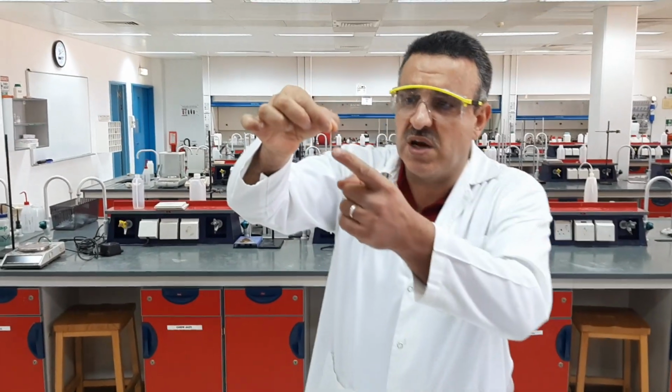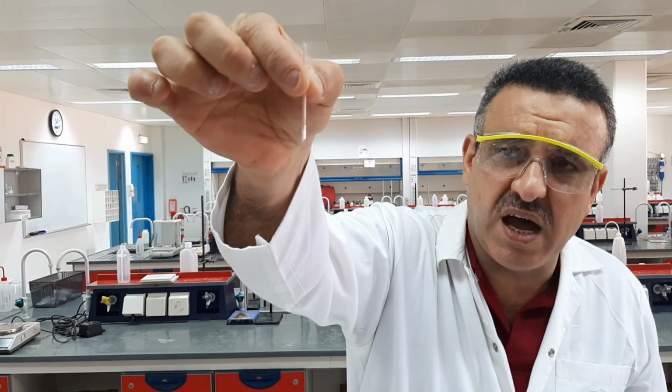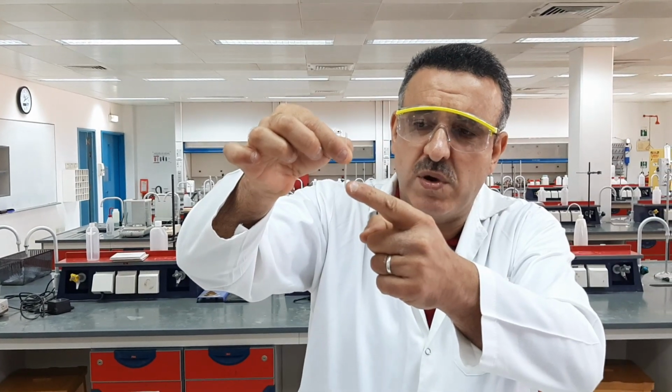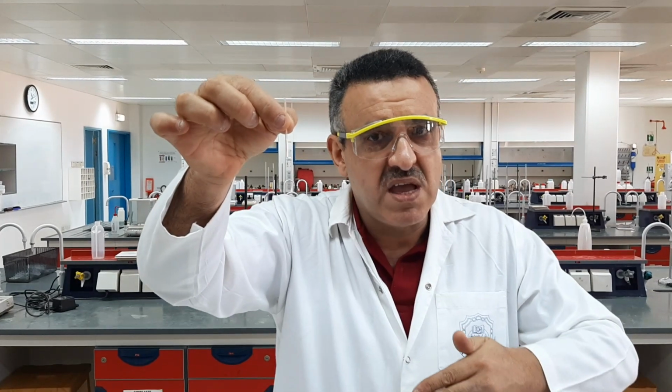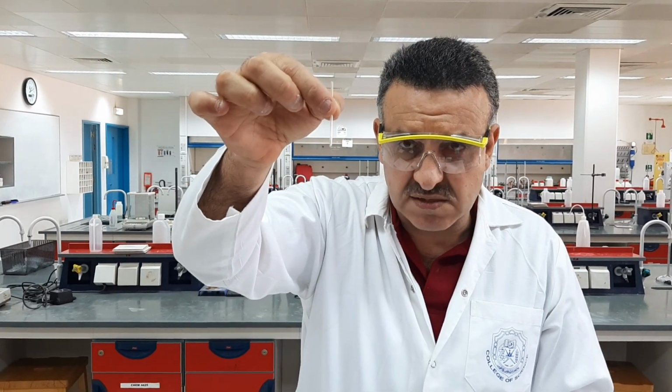You see, we do not add much of the compound, and the height of the powder inside the capillary tube should not be more than 1 to 2 millimeters high, in order again to have as accurate and precise a reading as possible.